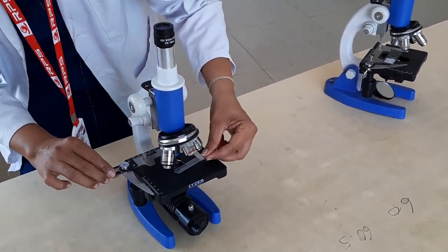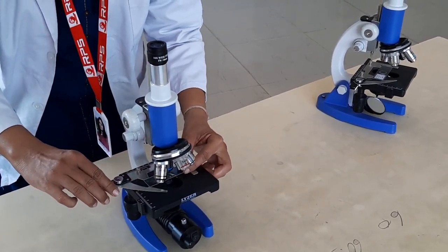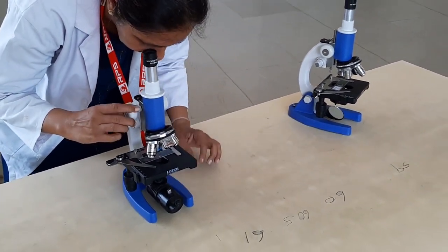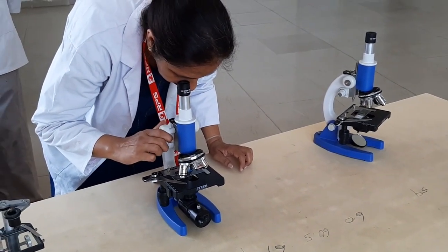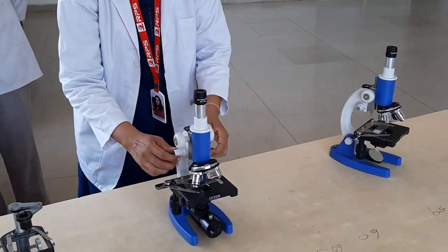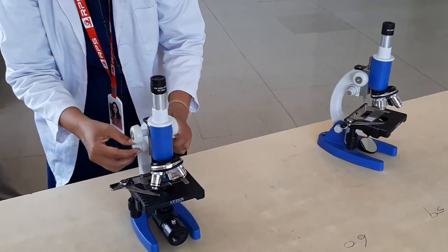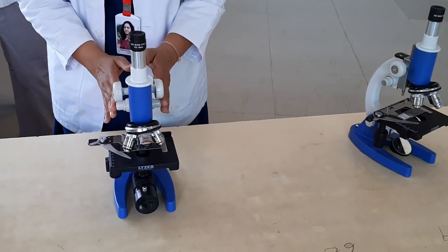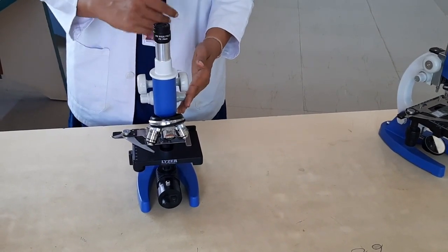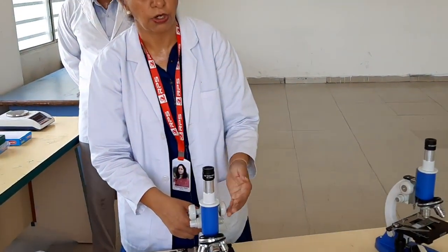Keep in mind — don't just randomly move the coarse knob. First, keep your eyes at the eyepiece, adjust the light, and then move carefully. Once it gets focused, that is the coarse focus. For fine focus, we use the smaller knob, which moves only a small amount but gives a very fine focus. This is how we focus on slides of different tissues, organs, or organisms.